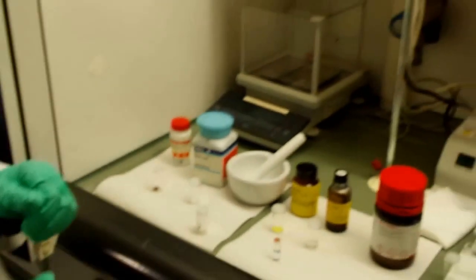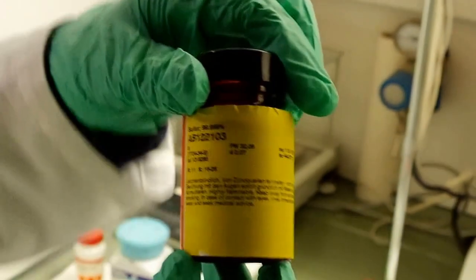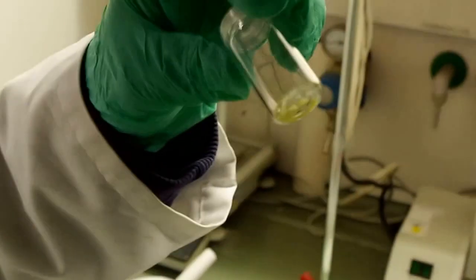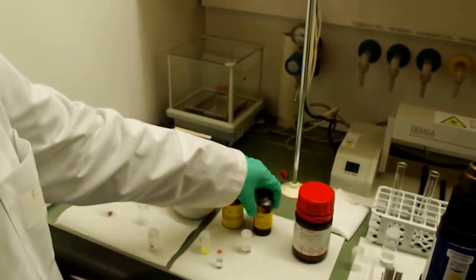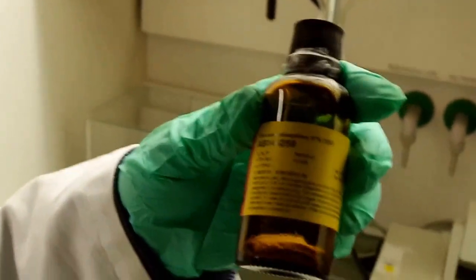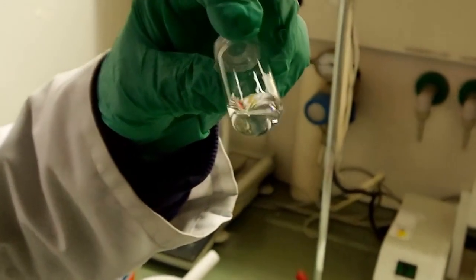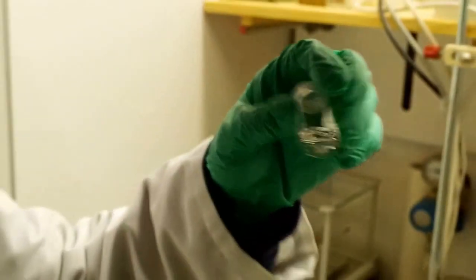We make cadmium sulfide, so our sulfur source is elemental sulfur, no problem with this chemical. It looks like this. The sulfur we have to dissolve in trioctylphosphine, shortly TOP. It is a colorless liquid, but also take care with this liquid because it's harmful for the eyes.